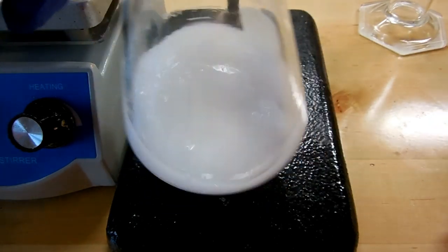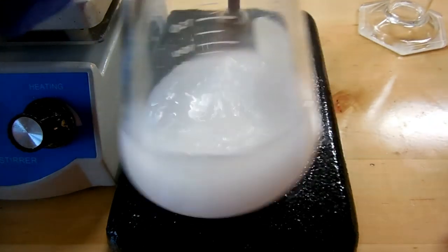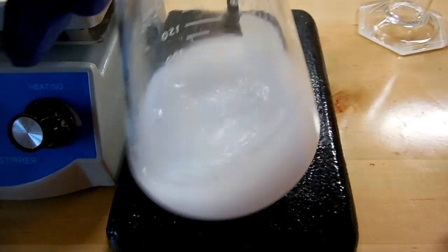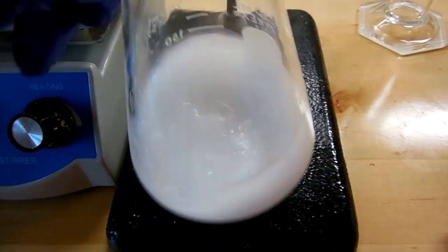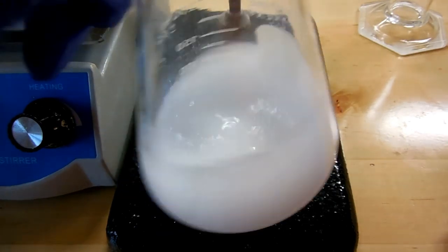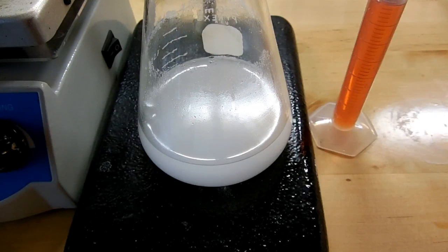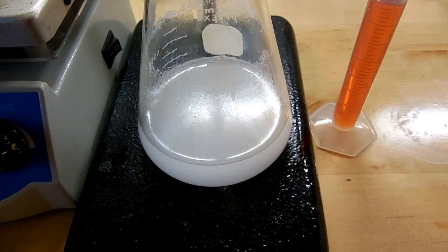Not all of it is going to dissolve because aspirin tablets are not entirely aspirin. There's binders and inactive ingredients and other things like that. I've mixed things around for a few minutes and gotten some of it to dissolve. There's still quite a bit of white powder on the bottom but that's the binders and that's not that big of a deal.